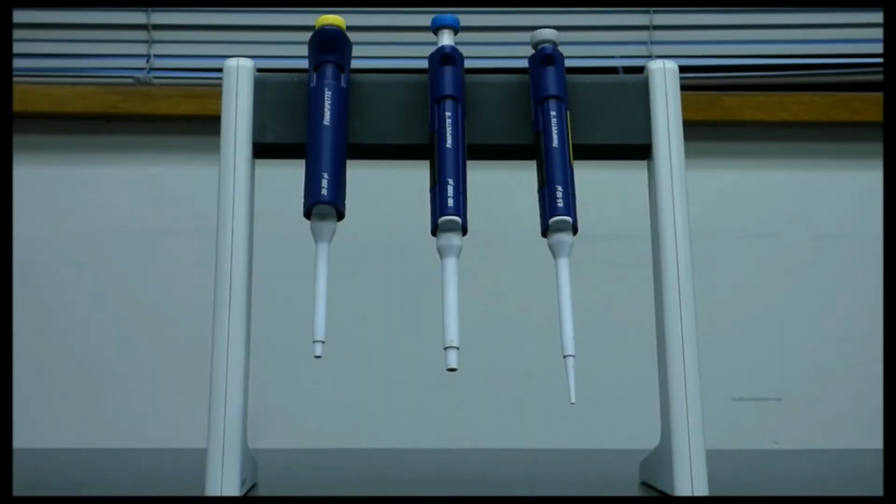In order for today's experiment to run properly, you will have to properly use a micropipetter. Before you start the experiment, go through the following exercise to become familiar with dispensing small amounts of liquid. It is important to use this piece of equipment correctly, because otherwise it will not deliver the correct volume.